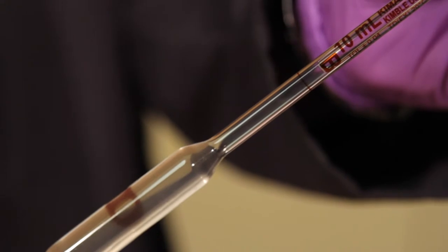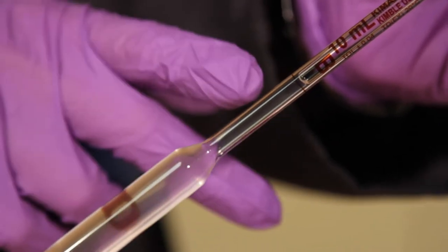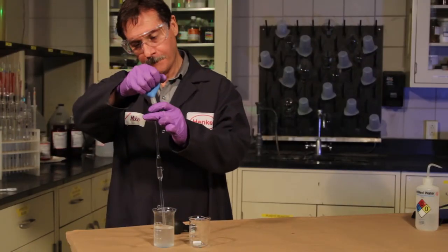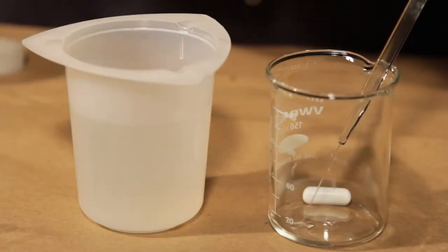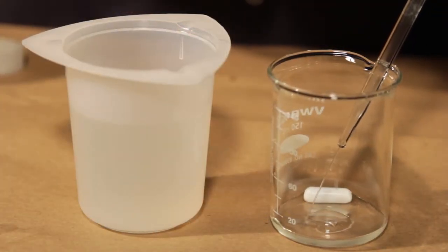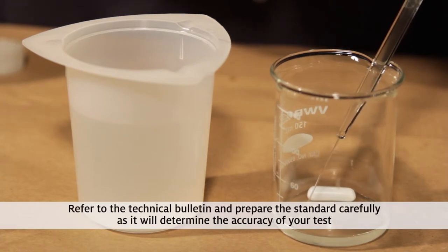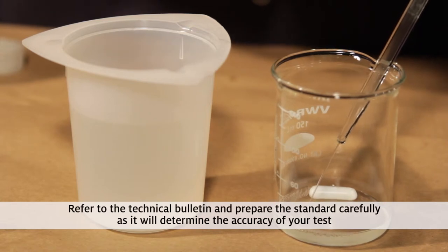When using a pipette, draw up your sample until the level hits the marked line near the top of the pipette. You may have to do this a few times before you become proficient at getting the level just right. Once you have the right amount of liquid in the pipette, you can allow it to drain into your titrating beaker or flask. Refer to the Technical Bulletin and prepare the standard carefully, as it will determine the accuracy of your test.